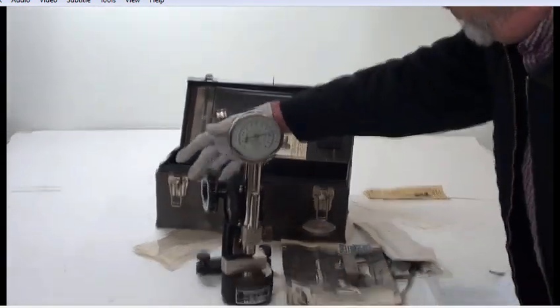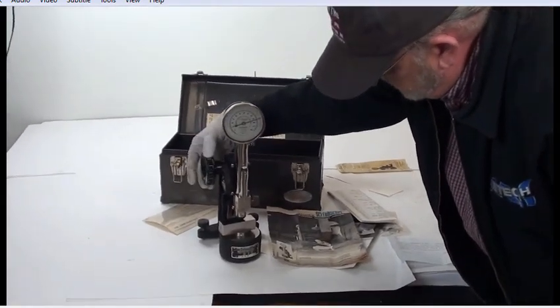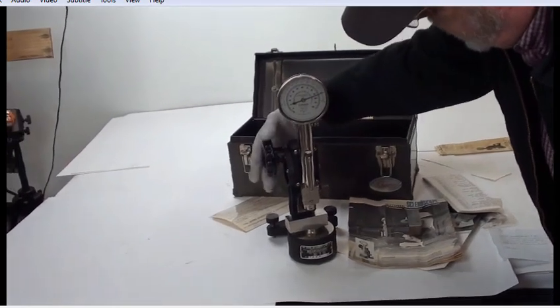What we have right now, the unit moves up and down with the dial.